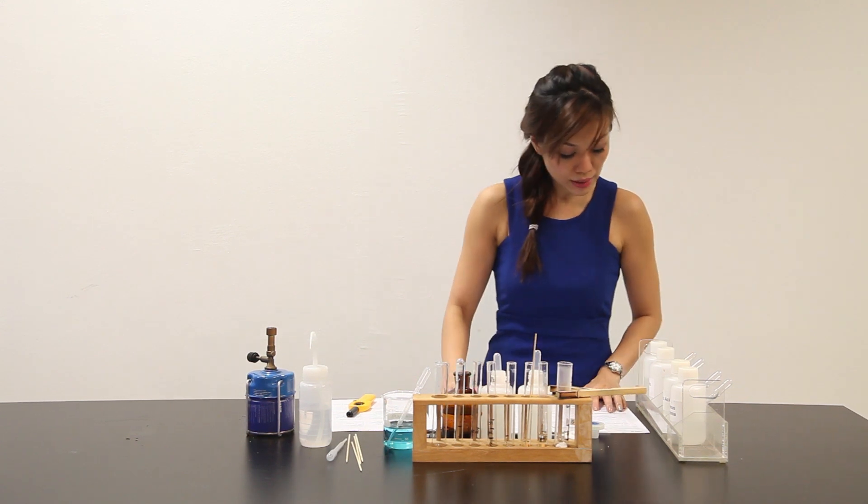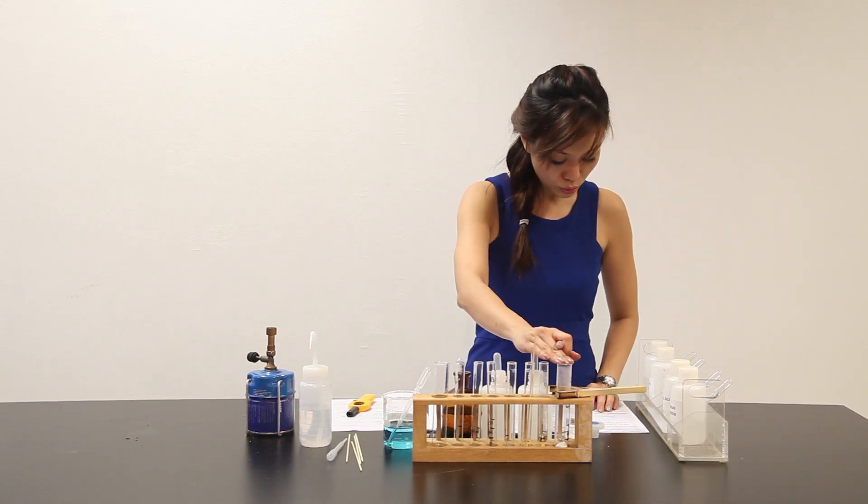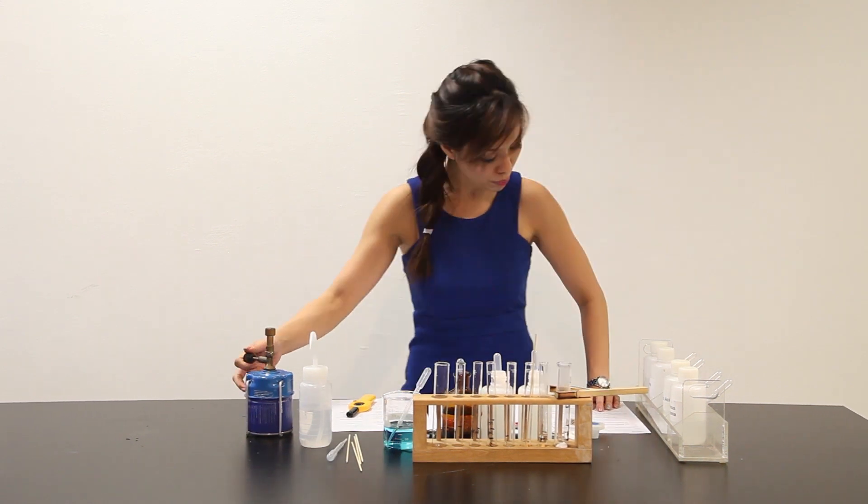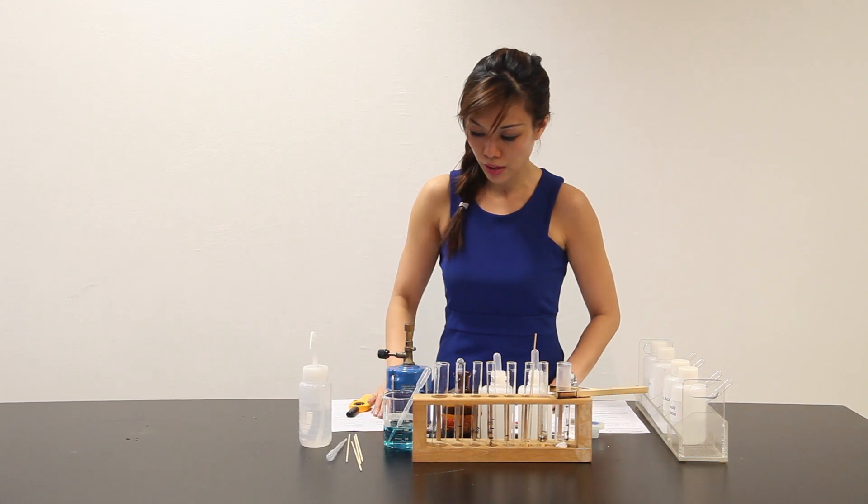Let's move on. They say, allow the hard glass test tube to cool completely. While you're waiting, continue with test B and C. So, I'm supposed to turn the Bunsen burner to give a blue flame.